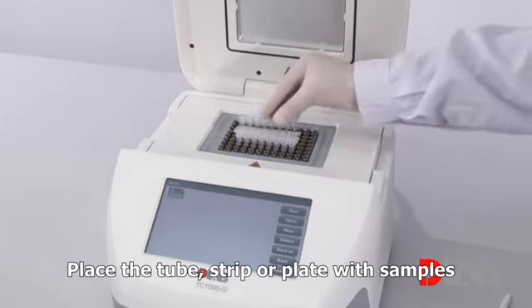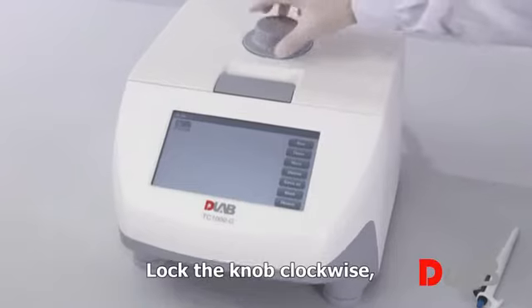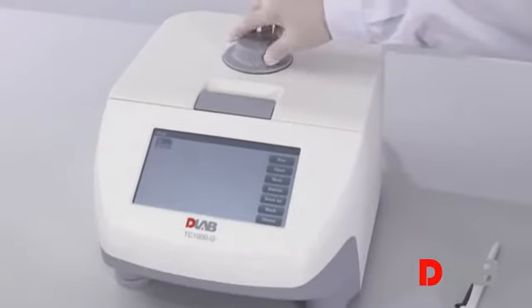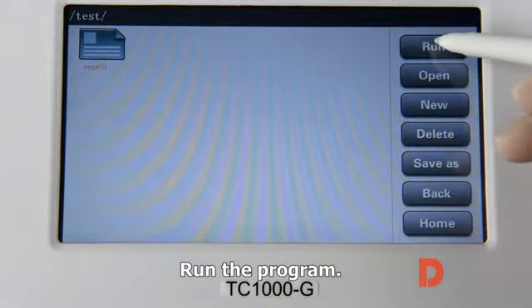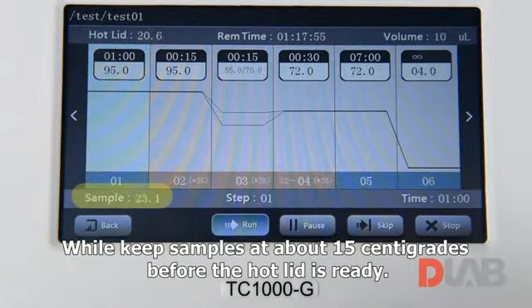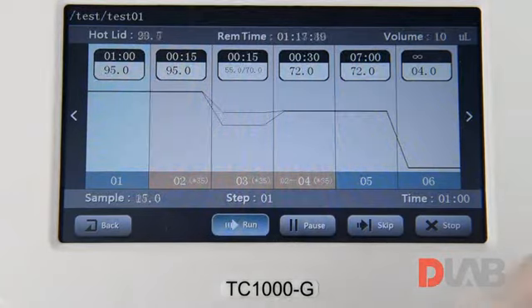Place the tube strip or plate with samples. Close the lid. Lock the knob clockwise until you hear the clicking sound. Run the program. The hot lid is heating, while keeping samples at about 15 centigrade before the hot lid is ready. The estimated time is 1 hour and 17 minutes.